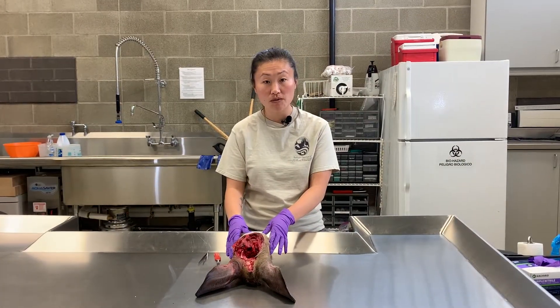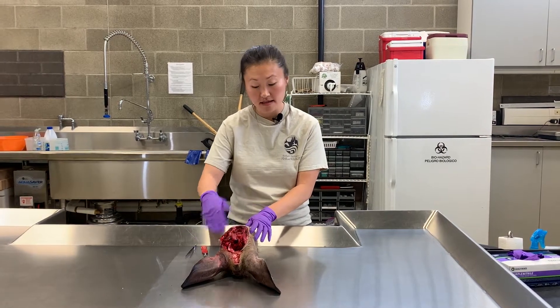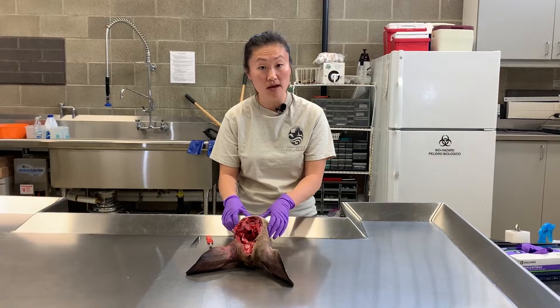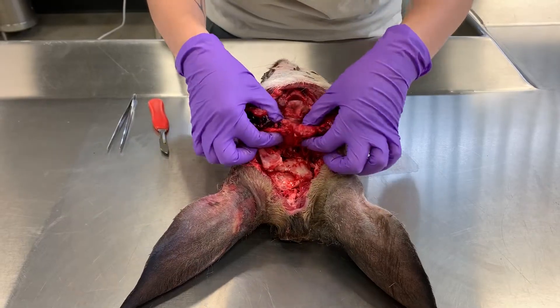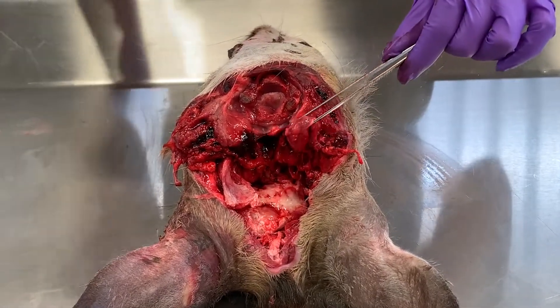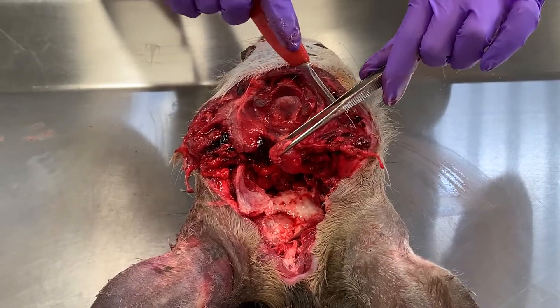What you're going to want to do is first cut the neck just behind the jaw — you'll feel the jaw, and then aim for a line that is right behind the ear, just like how this head is cut off, because those lymph nodes that we're targeting sit right behind the windpipe. On this one, it's really nice to see they're both right here.